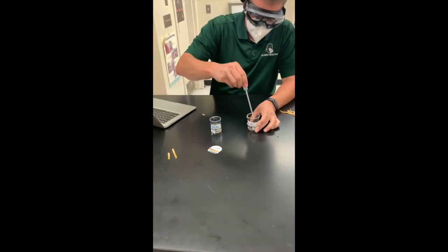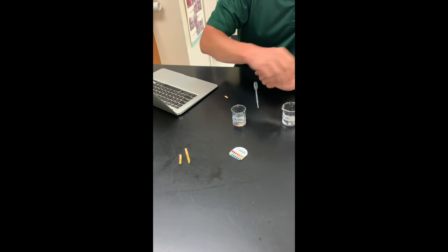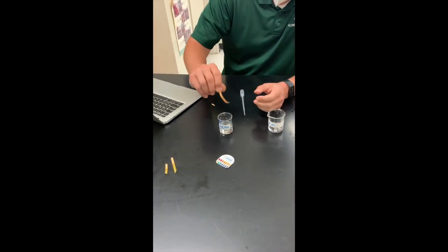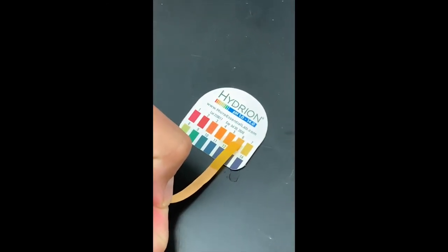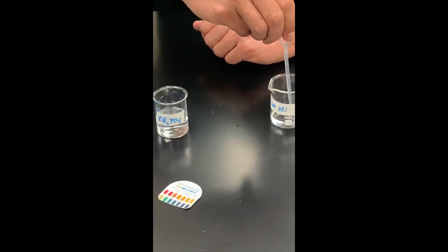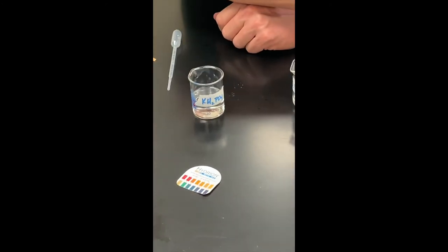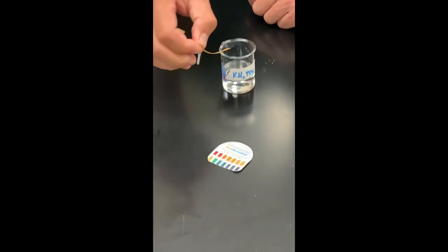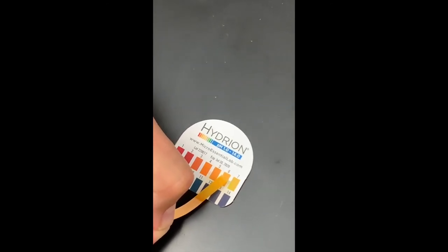So another milliliter of our hydrochloric acid goes in — swirl, check. I think we're at six now. So we're sitting at six at our second milliliter. Third milliliter of hydrochloric acid — swirl, make sure we get it mixed throughout — check. Still appears to be sitting right at six. I don't think it's as orange as the five is yet. So we're still sitting at six after three milliliters.